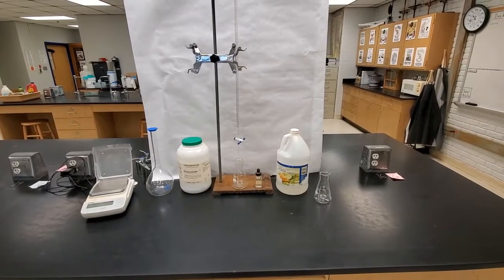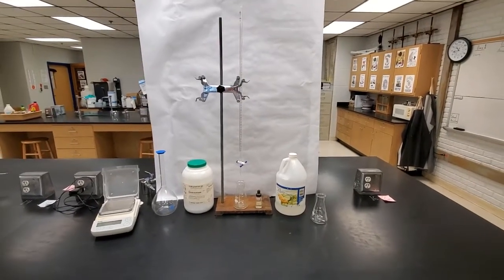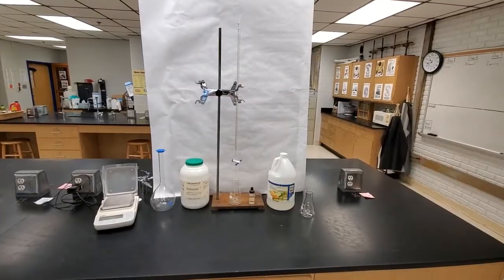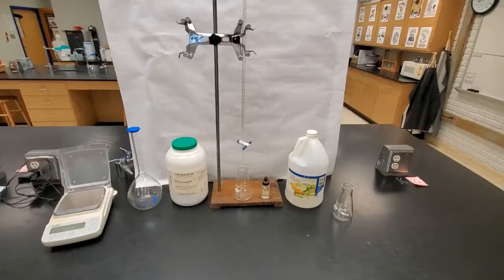Hey guys, Mr. B here. We are going to be doing our titration lab today. So I have everything set up here. I put a nice little white background for you so we'll be able to read our burette a little bit. But let me just talk through what we're going to do.